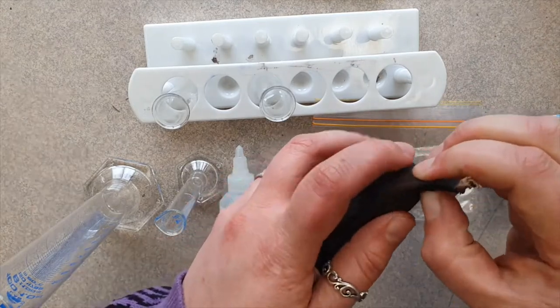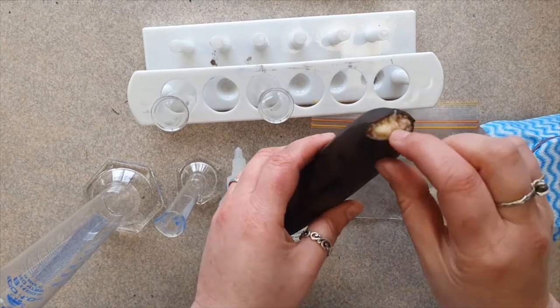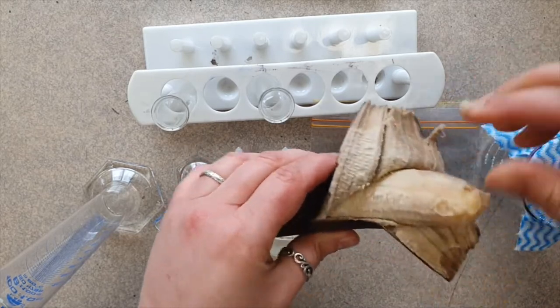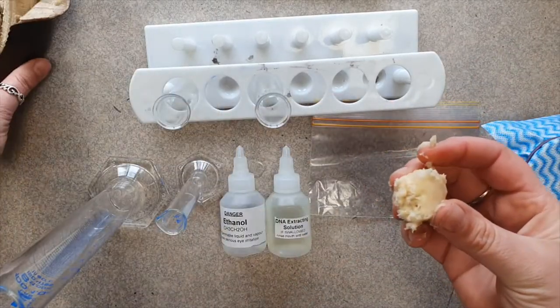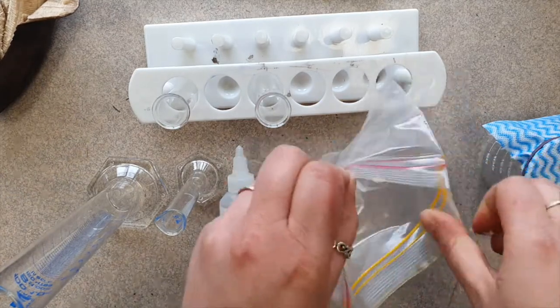Oh my god this banana is so old. Hang on. All right, problem solved. Okay so I'm just gonna grab a tiny bit of banana. Put the banana in my ziploc bag.